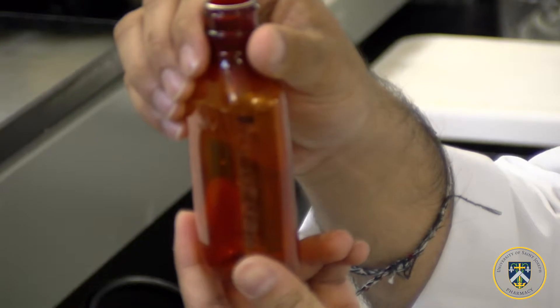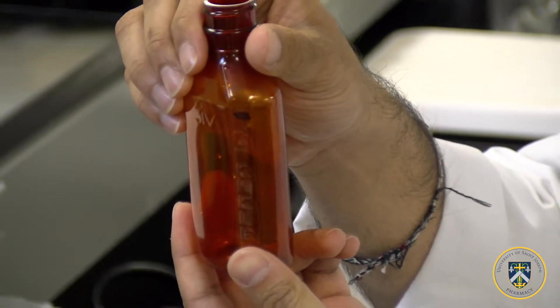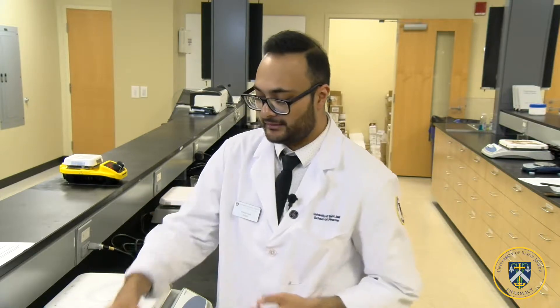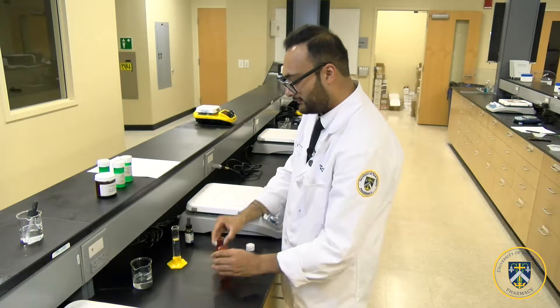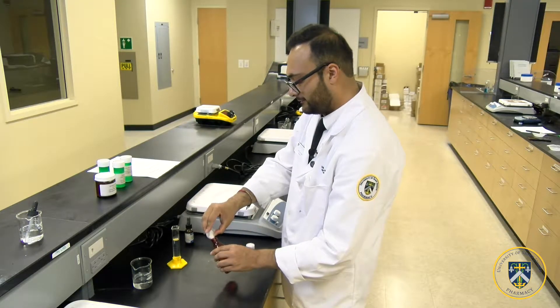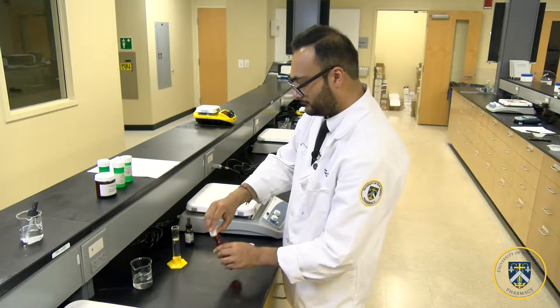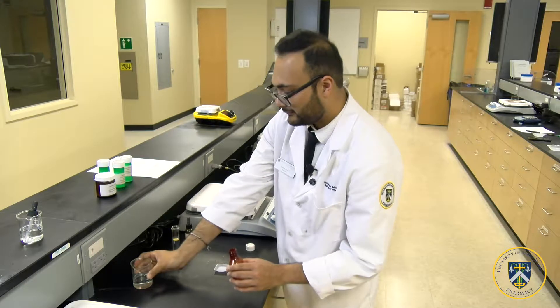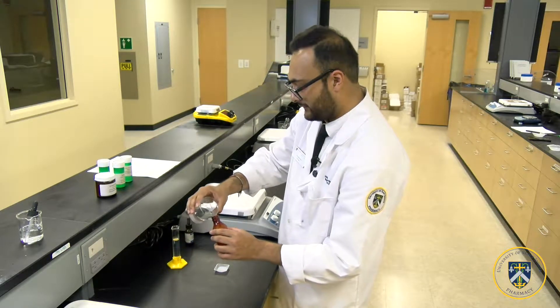If you don't have a 100 ml amber vial, you can always calibrate one to 100 ml by pouring 100 ml of water, marking the area where it is 100 ml. So to begin, add the vancomycin powder into your bottle, and add a small amount of purified water to dissolve the powder.